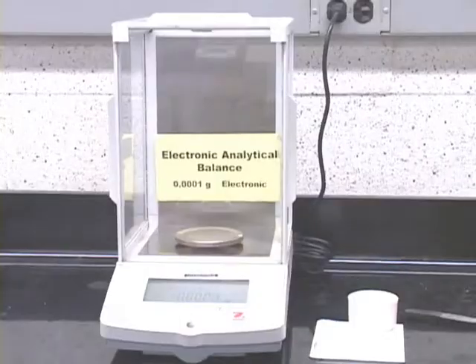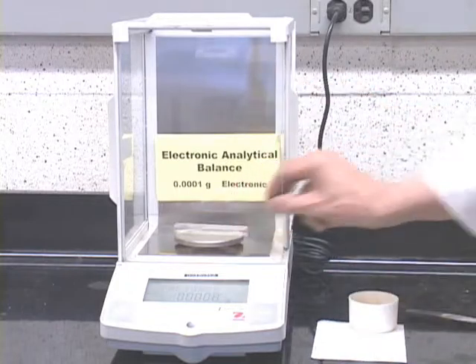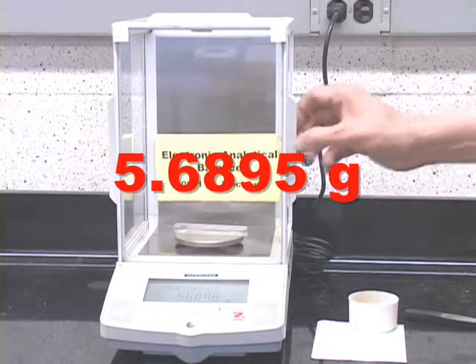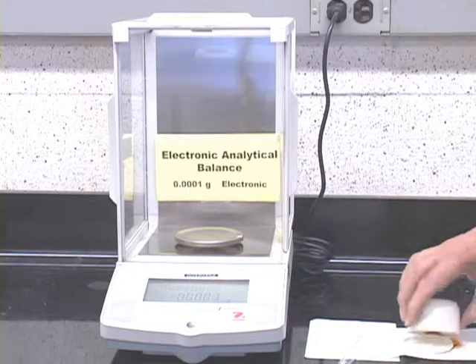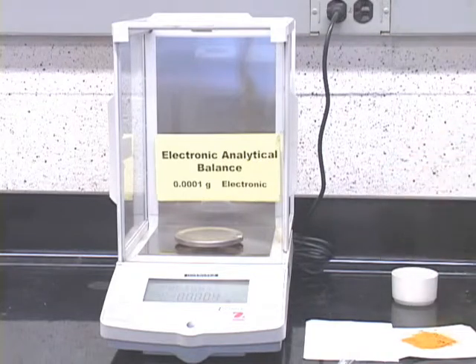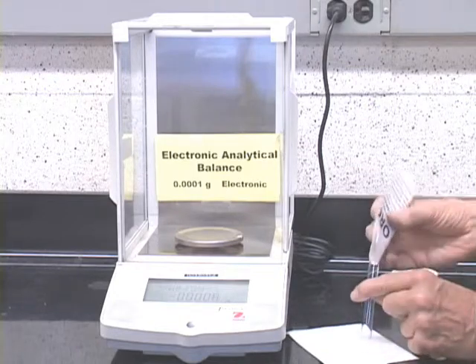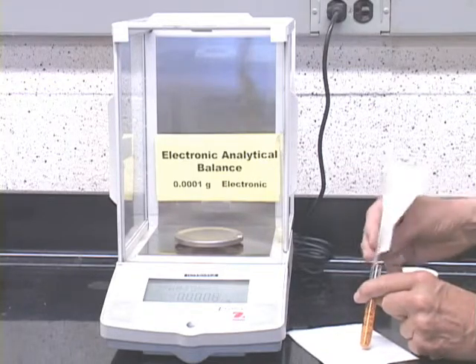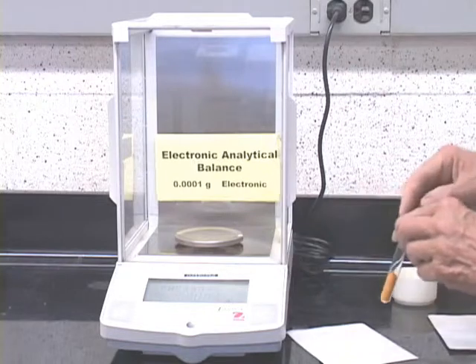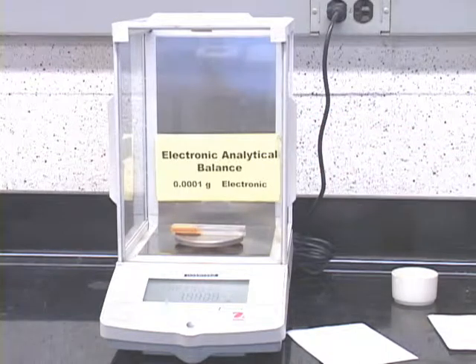When the product is dry, weigh an empty sample tube using an analytical balance. In using the analytical balance, remember to keep the doors closed and zero the balance first. Transfer the product into the sample tube. Do this carefully and gently to make sure you do not transfer any filter paper lint. And we weigh. Always close the door when weighing.